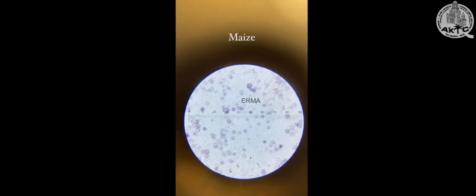Here we have taken maize sample. First, horizontally count the lines and take that as breadth. Now adjust the eyepiece vertically, focusing on the same grain of which you have taken the breadth, and count the lines. We have to take 20 readings in S form. Adjust the slide by stage controls by moving it in S shape.